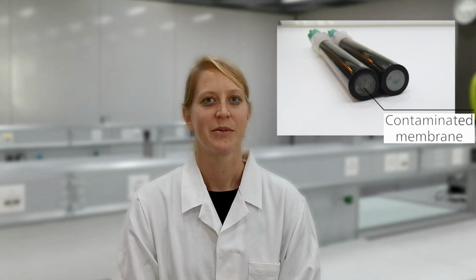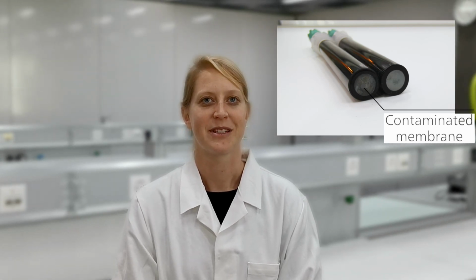In this video, I will show you how to clean a crystal membrane on an ion-selective electrode. This is necessary when you see deposits on the membrane or the response during a measurement or a titration becomes sluggish. Let's see how this goes.